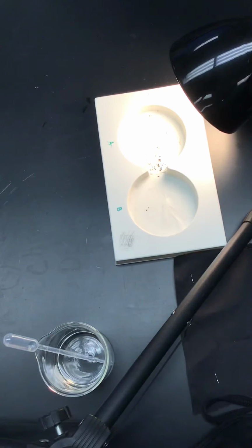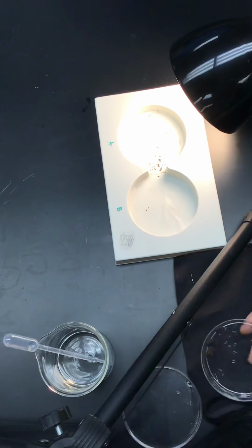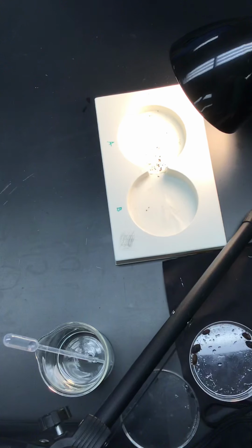Our results were a little bit contrary to what we have learned about where they live and that they like moist environments, because it seemed that the pillbugs actually spent more time on the dry side. This could be due to several factors. One could be the simple factor that they did not like the chemicals in the water, or that they might not have liked the chemical that they might have felt in the filter paper.